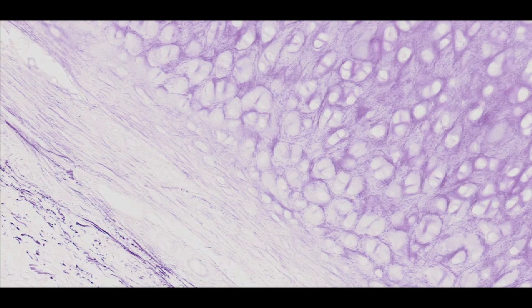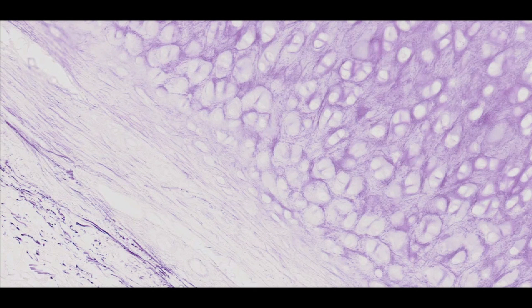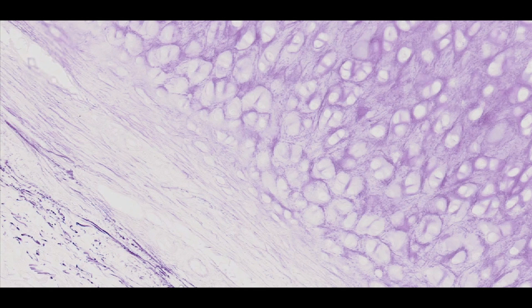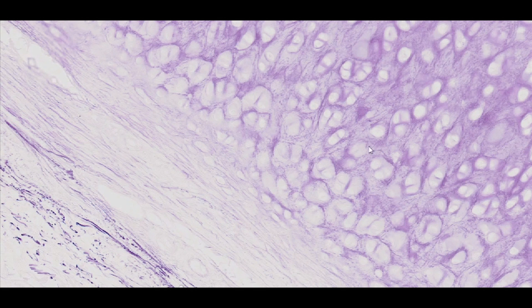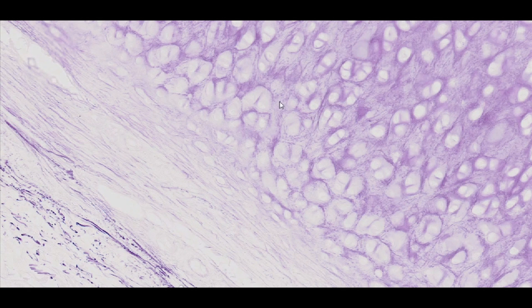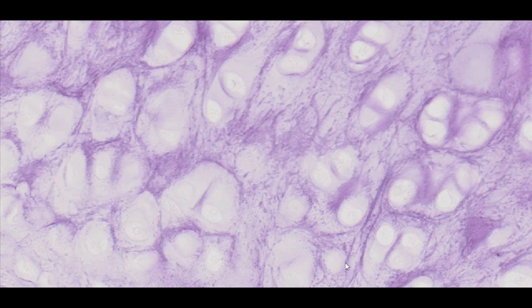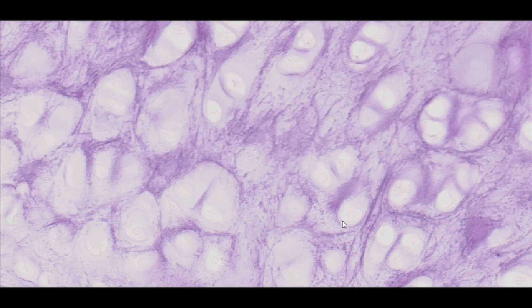Elastic cartilage has structure and composition similar to those of hyaline cartilage, but it is characterised by exceptional flexibility. The main difference between these two types of cartilage is the large amount of elastic fibres embedded in the ground substance of elastic cartilage. They have the form of multiple thin branching filaments stained dark purple with a resorcin-fuchsin stain. The particularly dense network of elastic fibres in the immediate vicinity of chondrocytes is noteworthy.